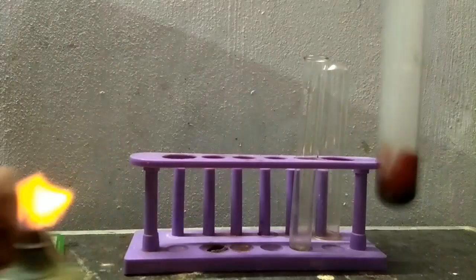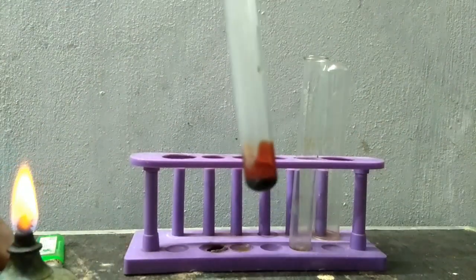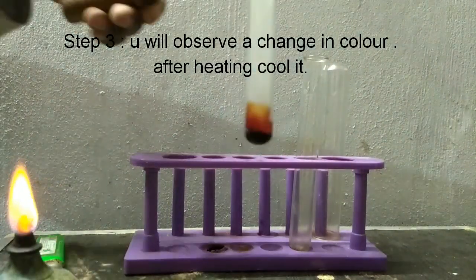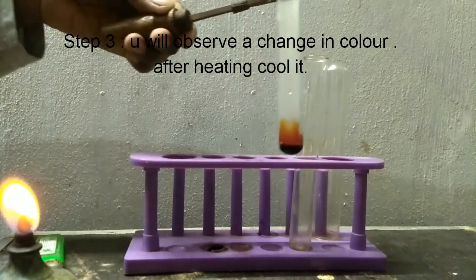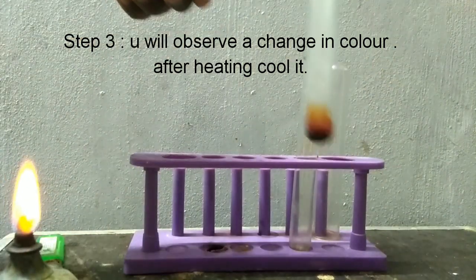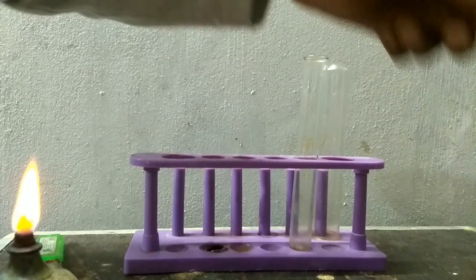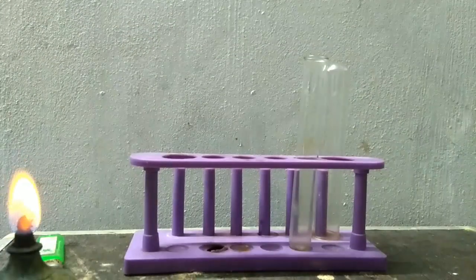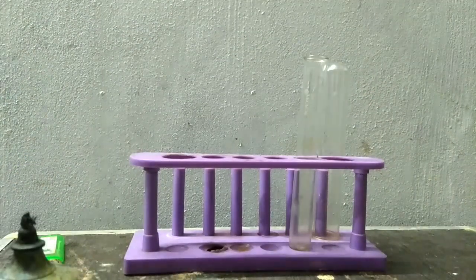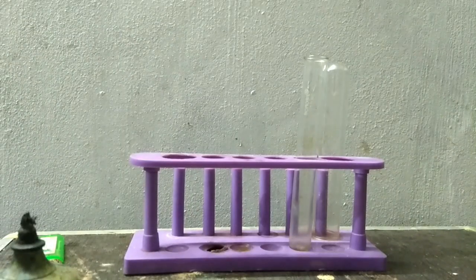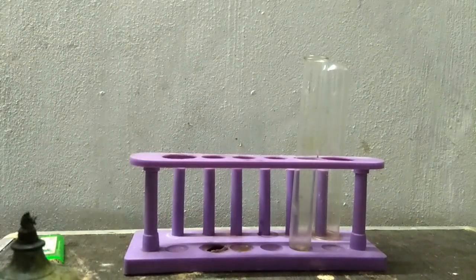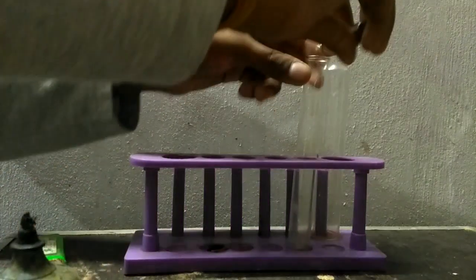After heating you will see a change in color. Now keep it aside to cool. Till then I am preparing another dye from alpha naphthol. So again I am taking alpha naphthol.